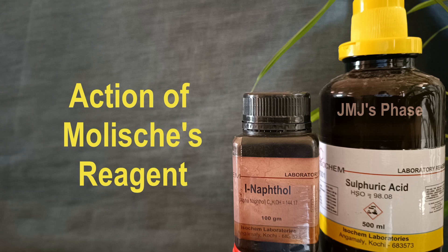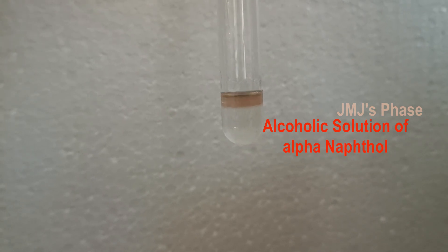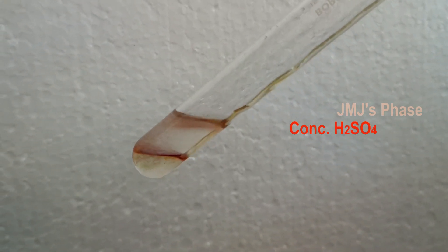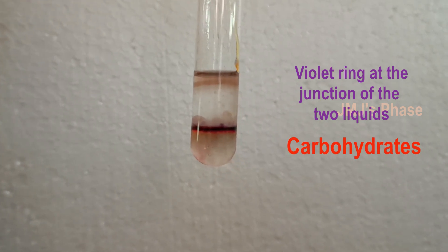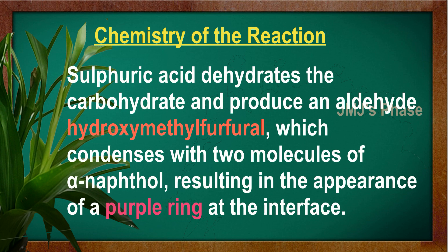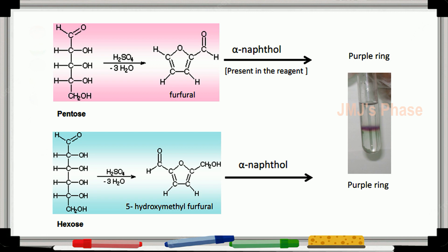Action of Molisch's reagent: Take a little of the substance, dissolve it in water, and add 2 drops of 1% alcoholic solution of alpha-naphthol. Then carefully add a few drops of concentrated sulfuric acid along the sides of the test tube without shaking. The formation of a violet ring at the junction of the two liquids indicates the presence of carbohydrates. The chemistry is that sulfuric acid dehydrates the carbohydrate to produce hydroxymethylfurfural, which condenses with 2 molecules of alpha-naphthol, resulting in a purple ring at the interface.